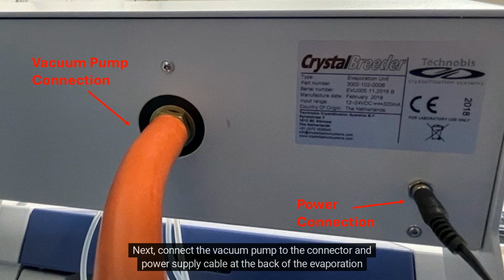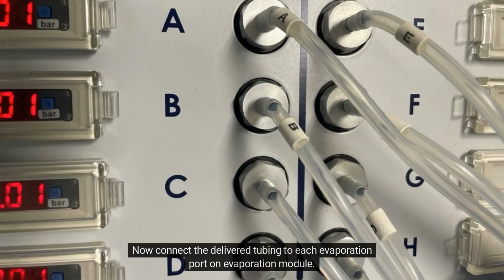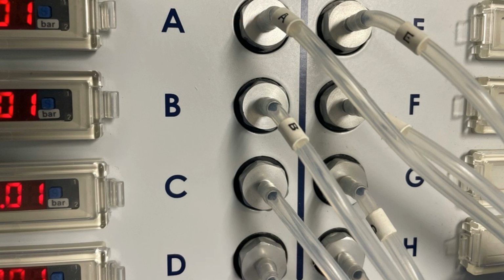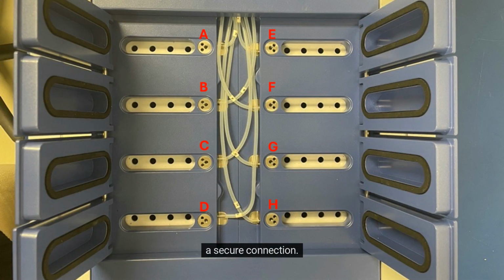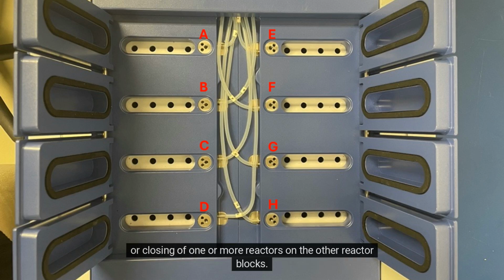Next, connect the vacuum pump to the connector and power supply cable at the back of the evaporation module. Now connect the delivered tubing to each evaporation port on the evaporation module. For example, tube from module connector A to reactor A. Attach the other end of each tubing to the corresponding block reactor on the CrystalBreeder system, ensuring a secure connection. All reactor blocks operate independently from each other, and there will be no pressure lost by opening or closing one or more reactors on the other reactor blocks.